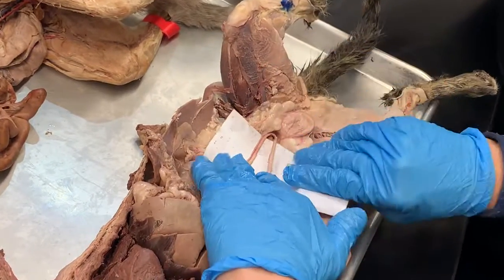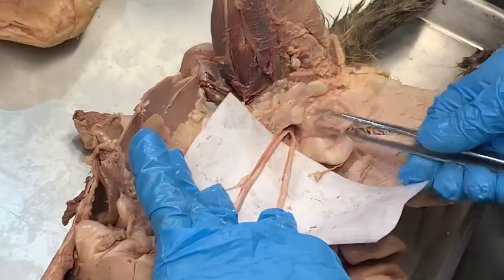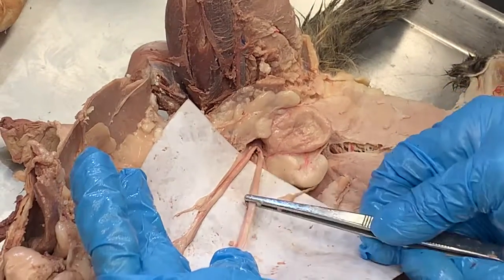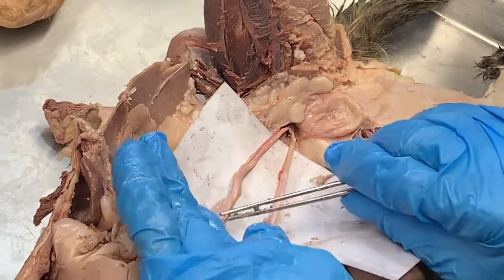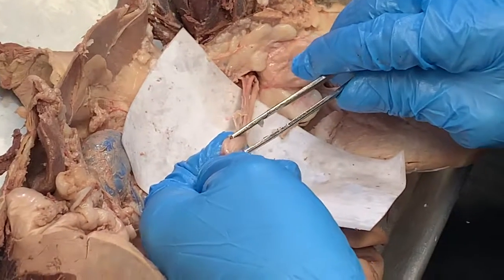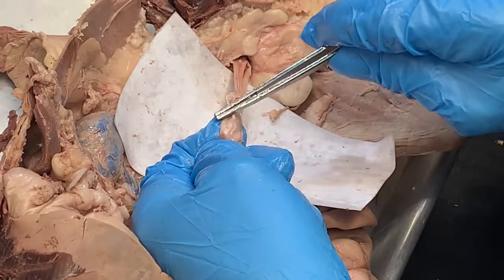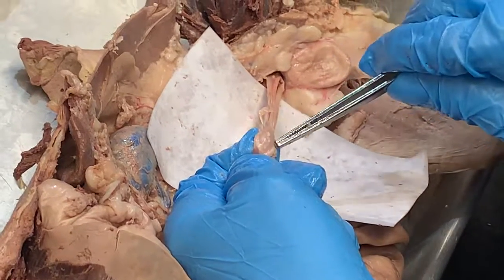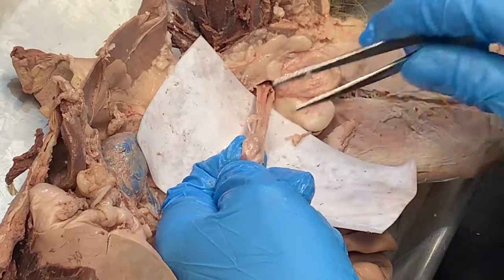Lay it like this. Down here, we see the body of the uterus, right there. These are the horns of the uterus, here and here. At the ends of the horns, we'll see kind of a seed or a pod. That's the ovary. And then this kind of squishy or kind of ropey stuff that wraps around the ovary is the oviduct. So ovary here, oviduct wrapped around it.